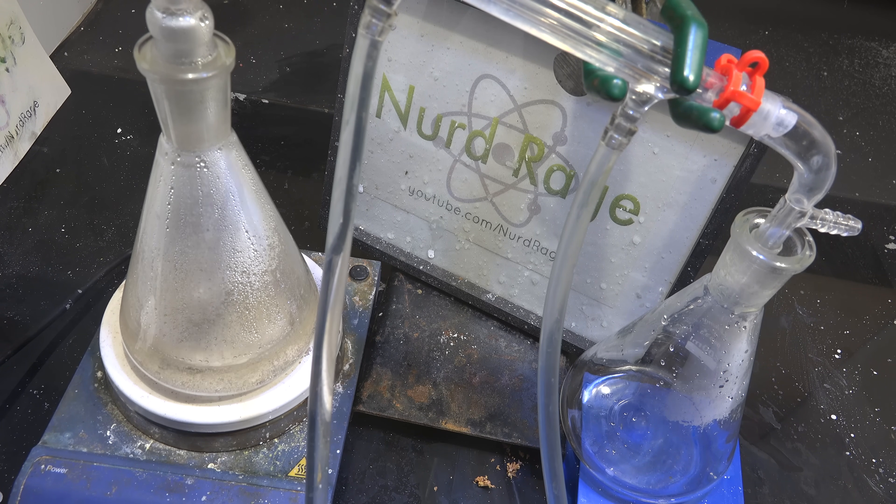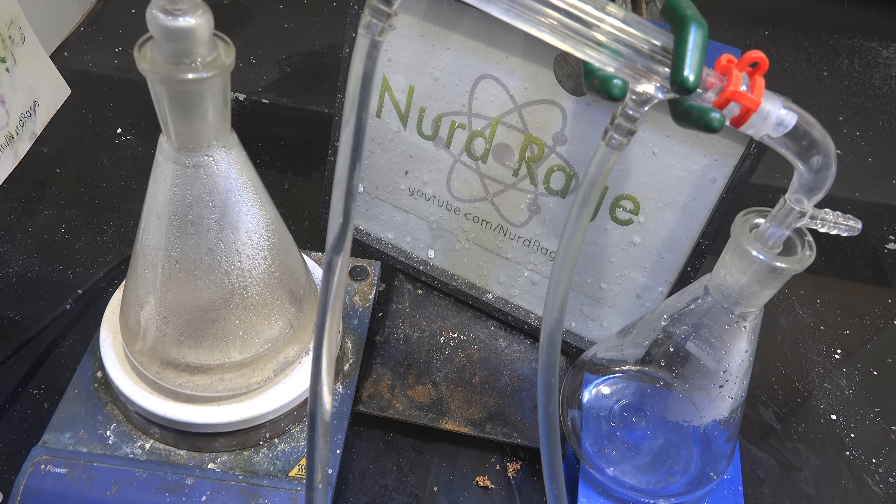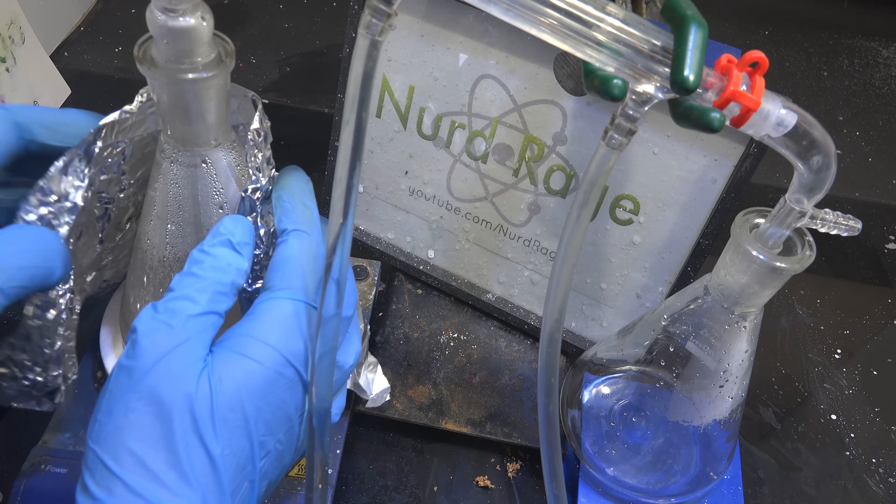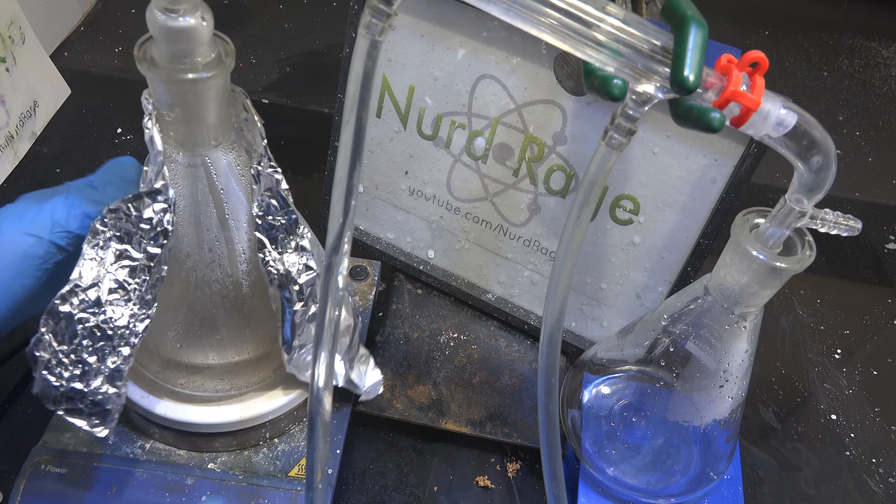Looks like the water is condensing inside the flask. I don't want refluxing, I want distillation. So I'm putting on the shroud of aluminum foil to keep the flask warm and help the water distill over.